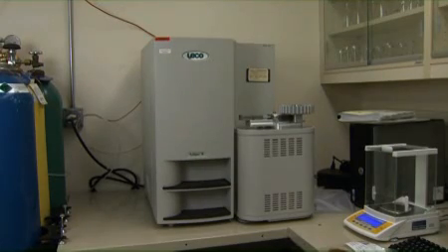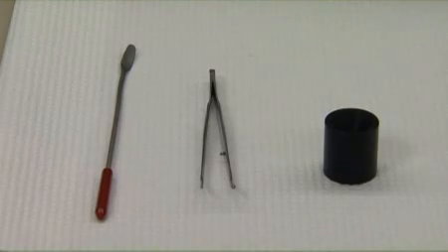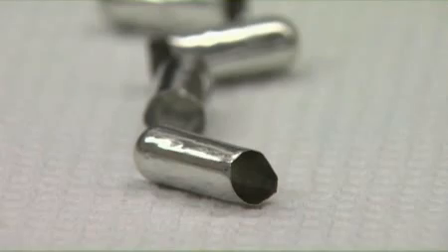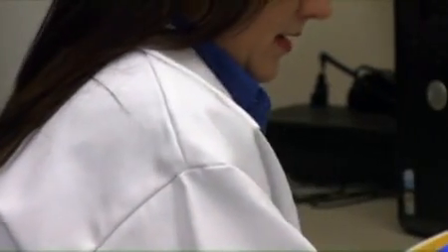The necessary supplies for percent protein are the LECO TruSpec nitrogen determinator, equipped with analytical balance, external computer system, and LECO software. Spatula, tweezers, cup and cap holder, large tinfoil cups for low moisture samples, tin capsules, 6 mm for liquid or high moisture samples, medium quick caps for dry samples only, and lab coat.